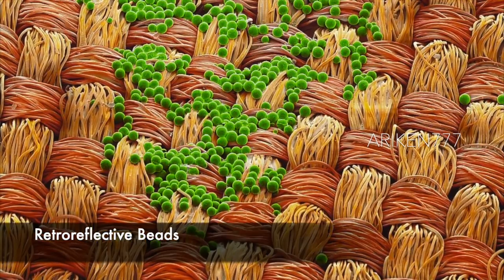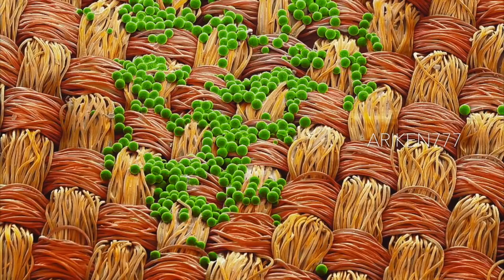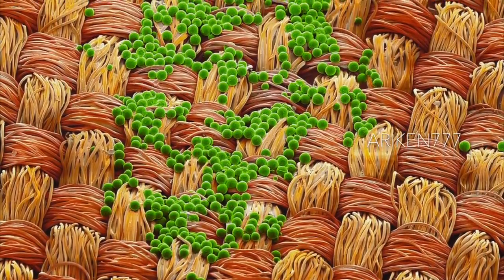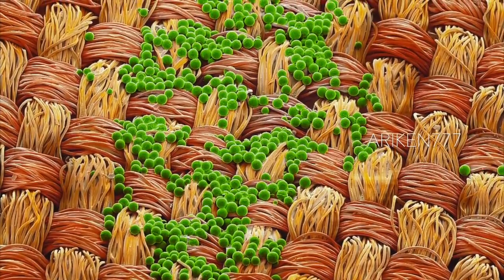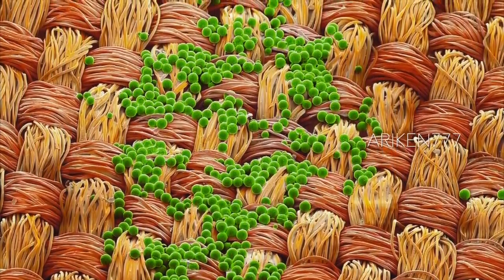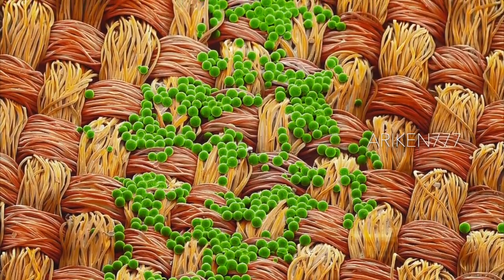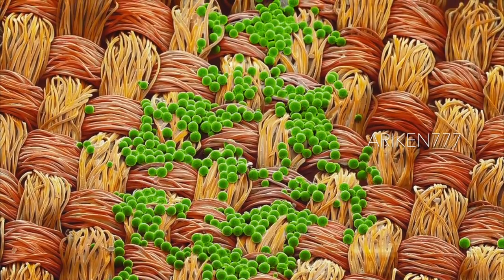These are retro-reflective beads on a fabric. Retro-reflection ensures better visibility in dark, twilight, or other low-light conditions, and very little light is lost due to lateral scattering. A layer of micro-sized glass beads, seen here in green, mounted on a layer of material is used to obtain retro-reflection. Retro-reflection means that most rays of light striking a retro-reflective surface bounce back in the direction they came from. Surface density and size distribution of the glass beads are critical to retro-reflection. The diameter of these glass beads is typically about 50 micrometers, and specific patterns can produce reflective logos.